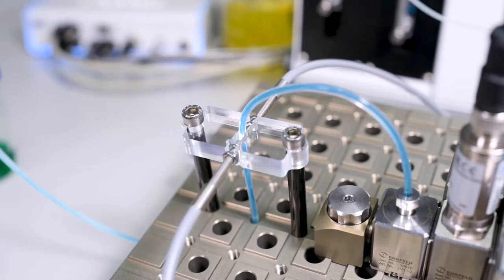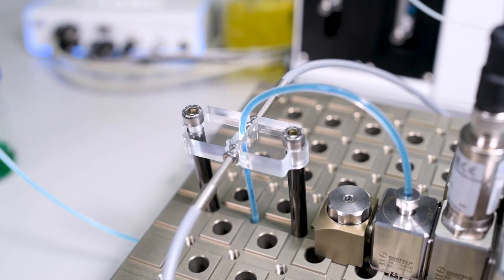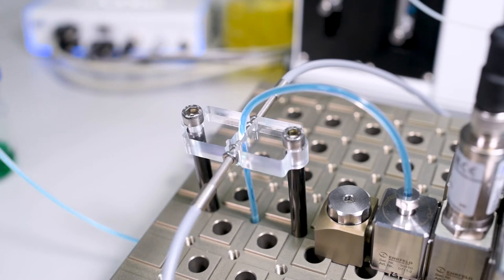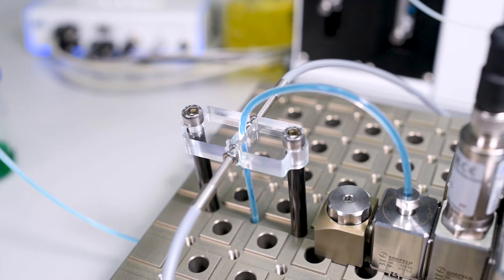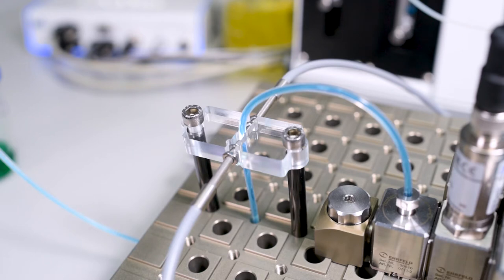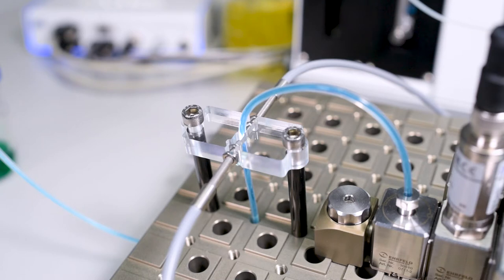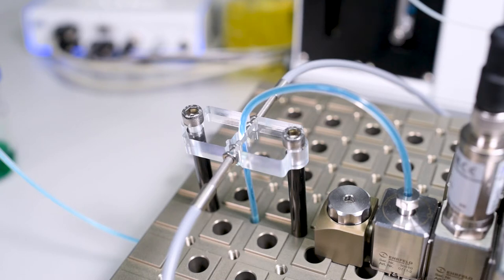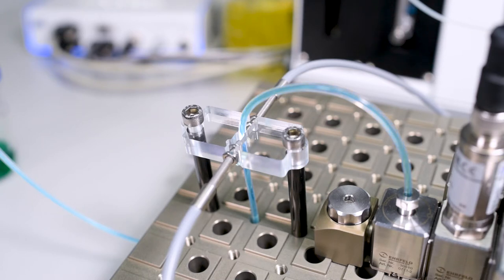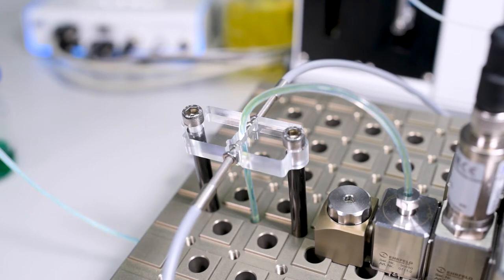At the outlet, we then measure the current color value of the liquid running through. This is of course a demo setup. However, this could just as well be a more complicated setup or used for chemical synthesis. And you could also, instead of the color sensor, use a different analysis device, such as a spectrometer or liquid chromatography.